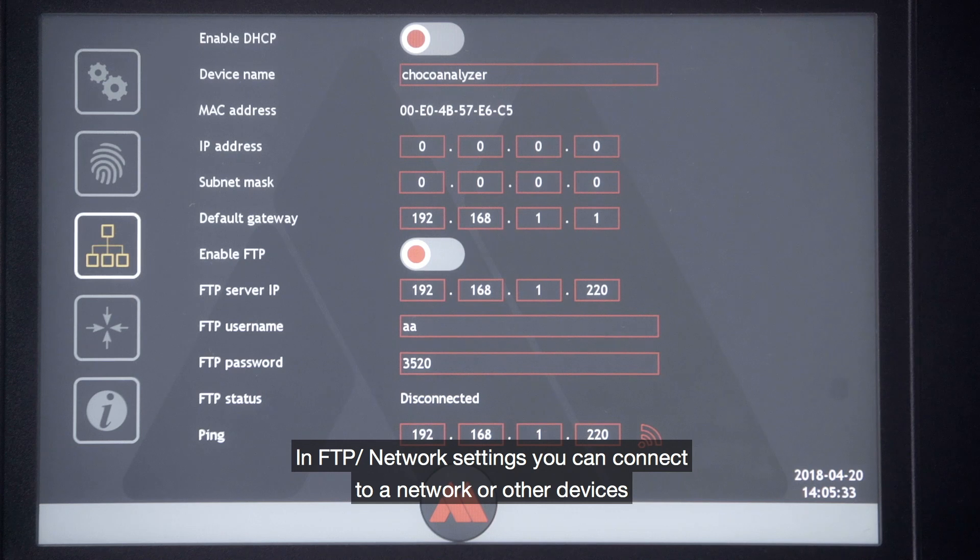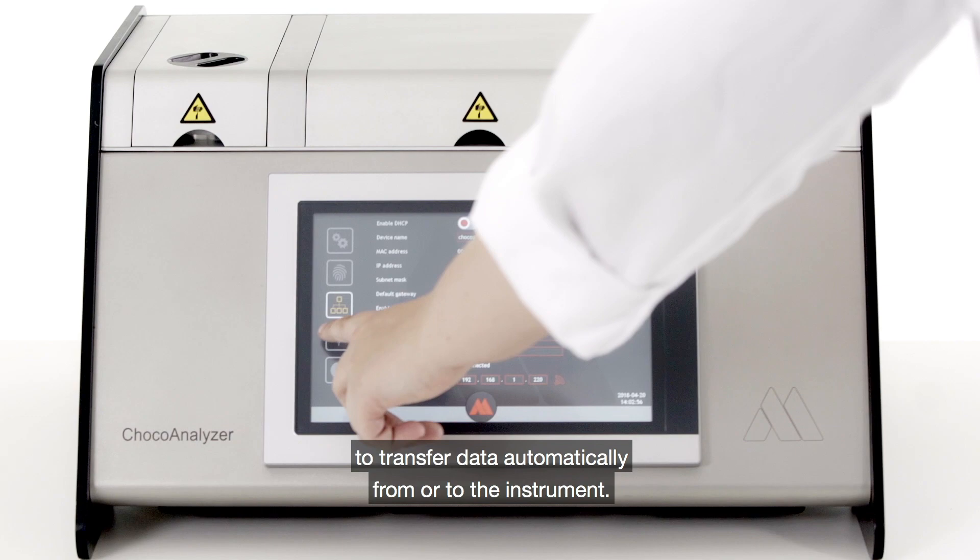In FTP settings you can connect to a network or other devices to transfer data automatically from or to the instrument.